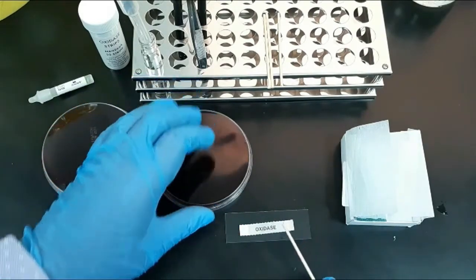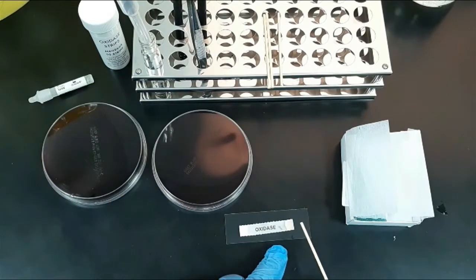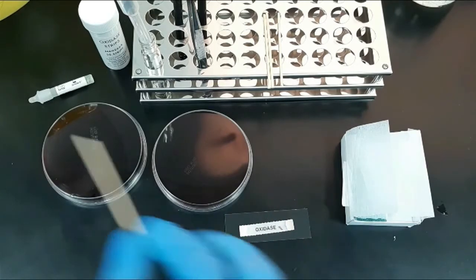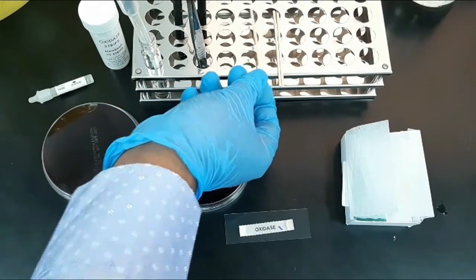Using a sterile wooden stick or disposable loop, drop or smear it onto one side of the paper. A positive reaction is indicated by the formation of purple-blue color within 10 seconds. Discard the stick immediately.